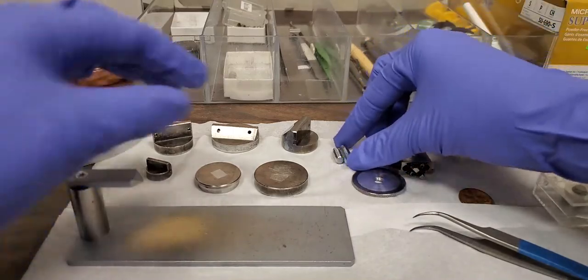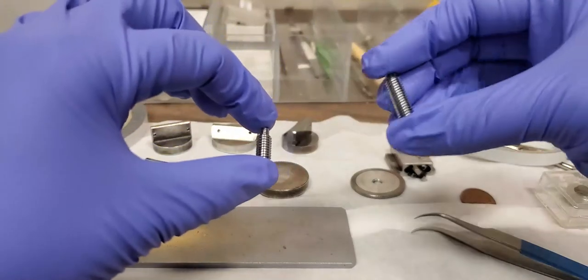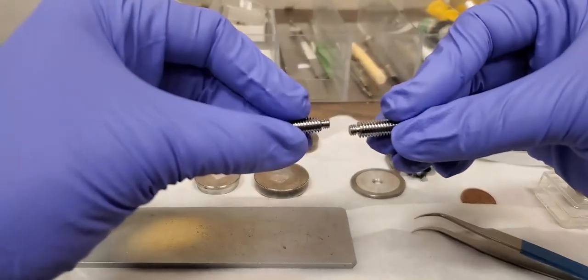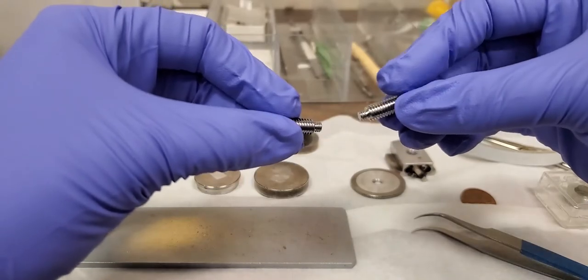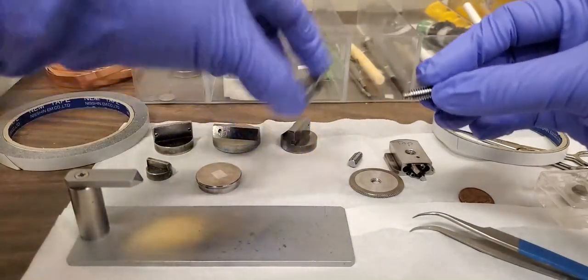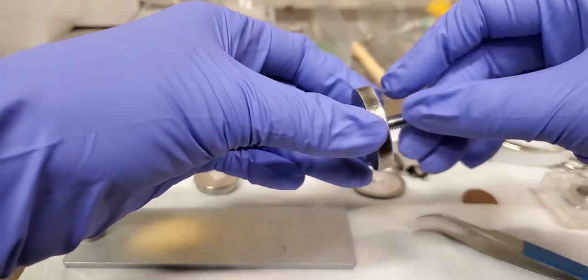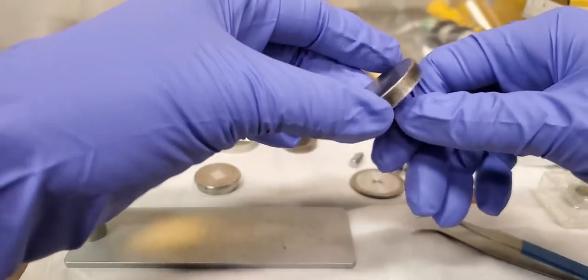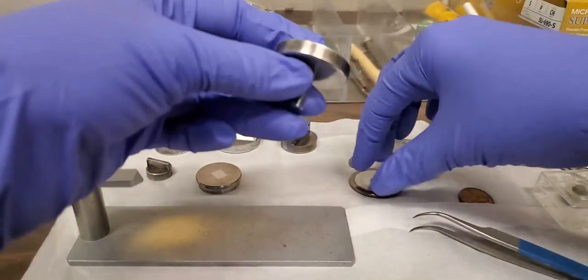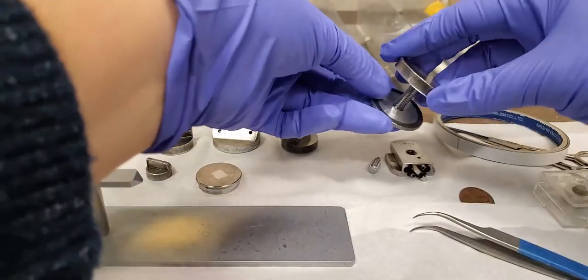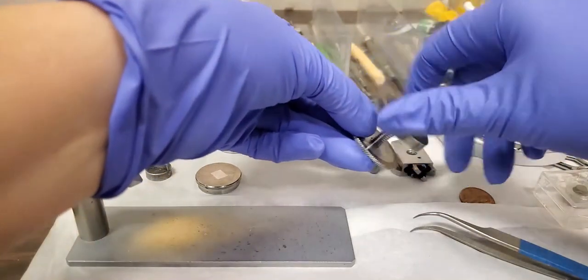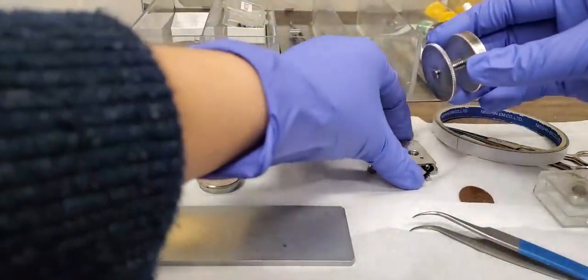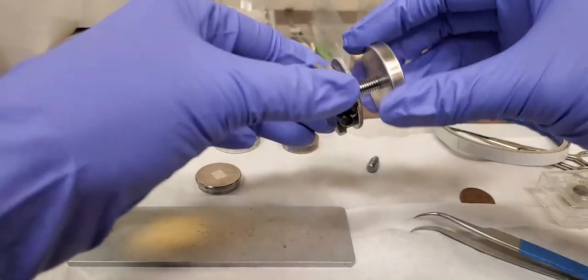The size of the screw depends on how tall your sample is. You can see the short end here screws into the base here. So we would use the longer one for really small samples. We can attach the washer and then we need to screw it on here.